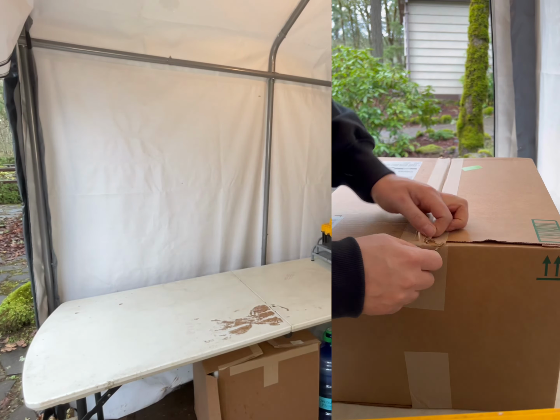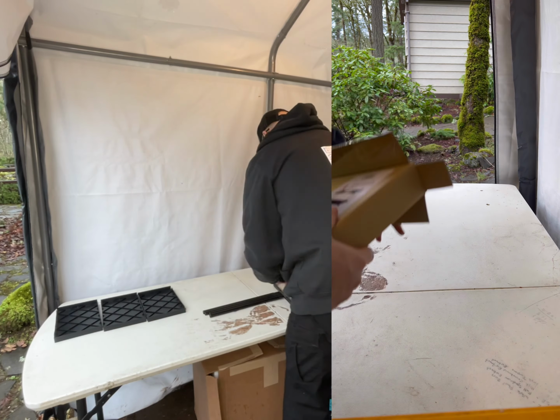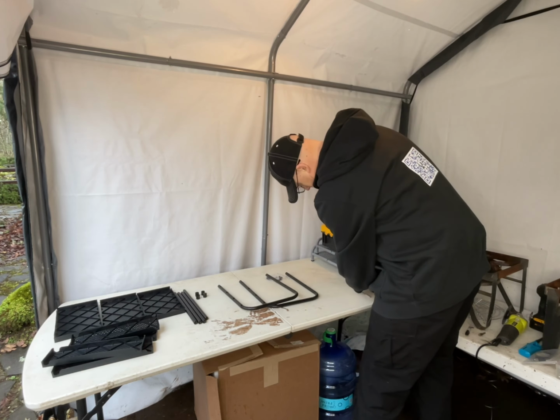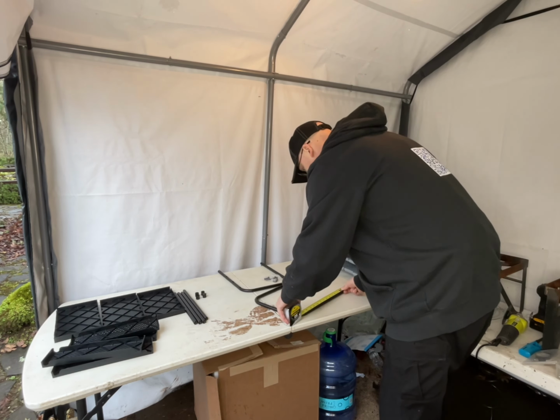Here we are with our simple two-tier shelf that we bought off Amazon. Now, I didn't check this out quite well enough. It ended up being plastic shelves, which for most of you might work fine, but I work with hot, heavy agar, so these shelves actually didn't end up working for me. But we'll see if they'll work for you.